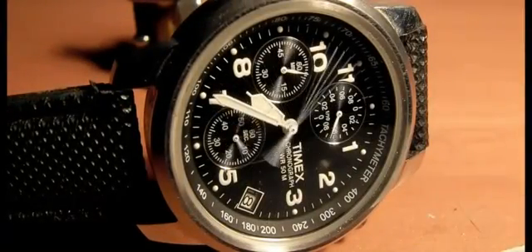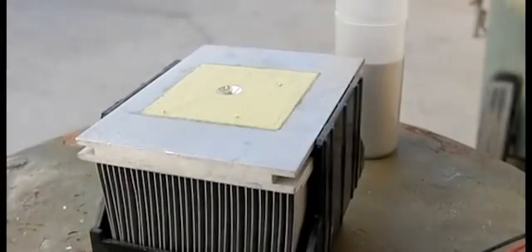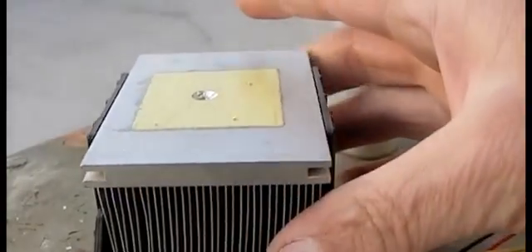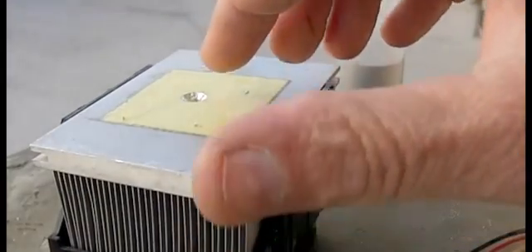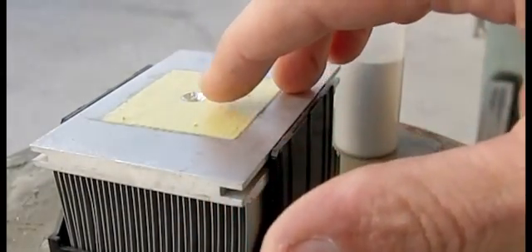Master arm on. Master arm on. Good light. In this experiment we're going to take an aluminum computer heat sink. I've already pre-drilled a little hole in it.